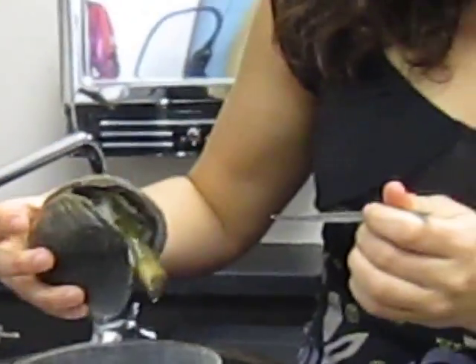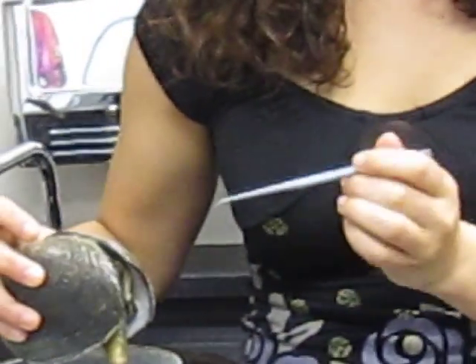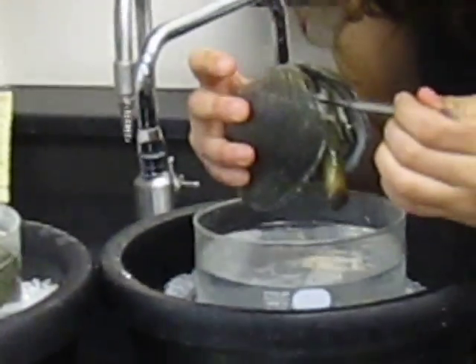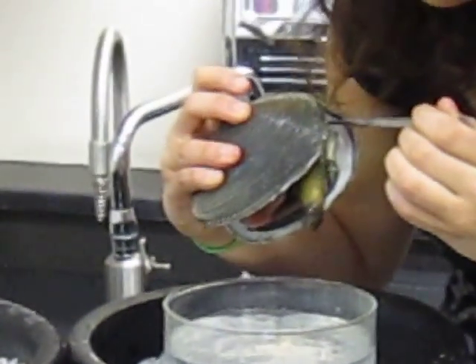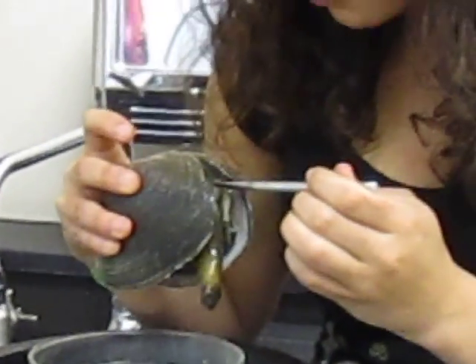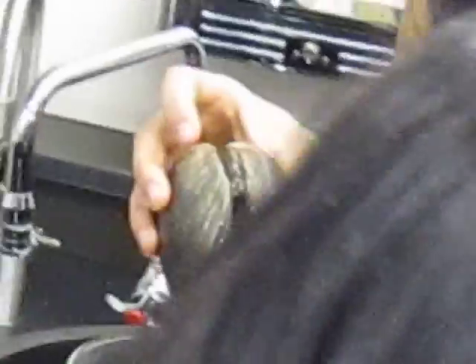So now let's talk about, well, first let me show you a few of the important organs within the visceral mass. I think the heart and the anus are not really visible in this one. But I will show you the heart. The heart is like a little tiny red mass. It's just like a red thing in there, like a splotch, reddish orange.